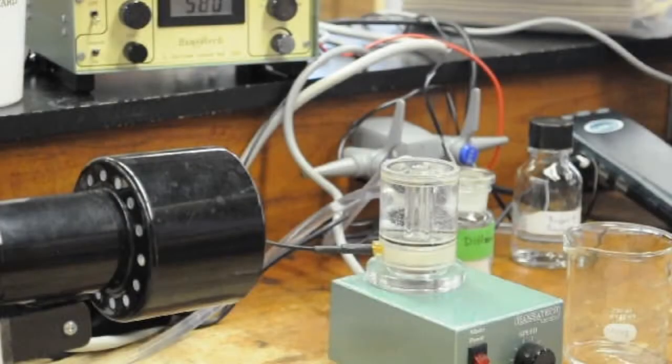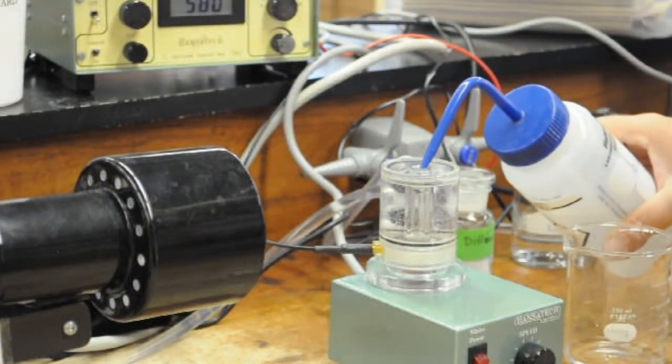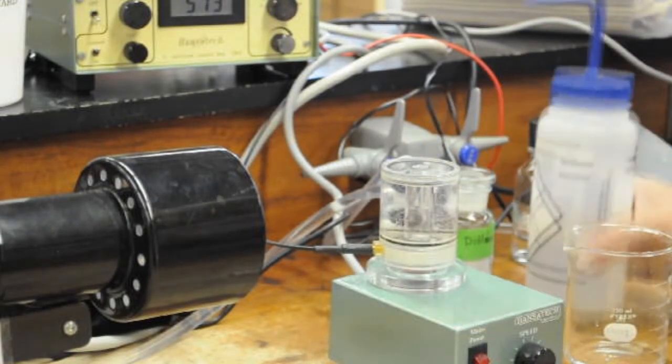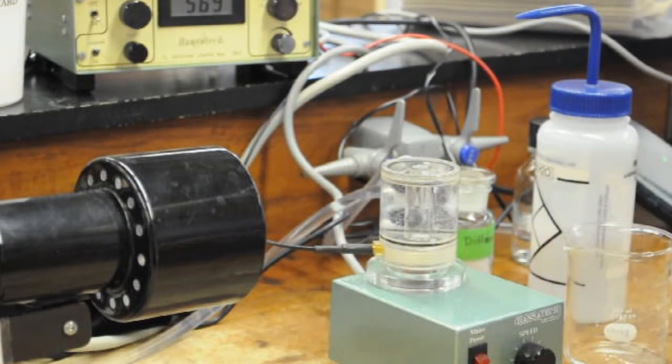Generally calibration is done once at the start of lab. Make sure there is some water in the cuvette. The exact volume is not important for this step. The left bottom switch on the control box should be set to cancel and the right top knob to one times. Record the millivolt output for air-equilibrated water. Generally this should be between 500 and 600 millivolts.